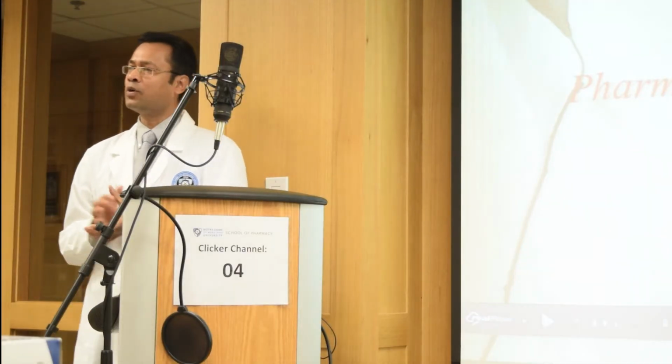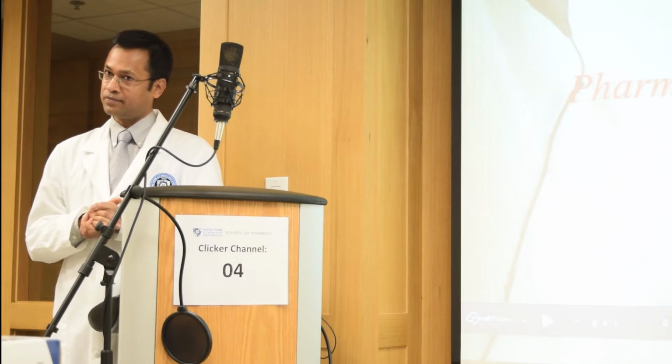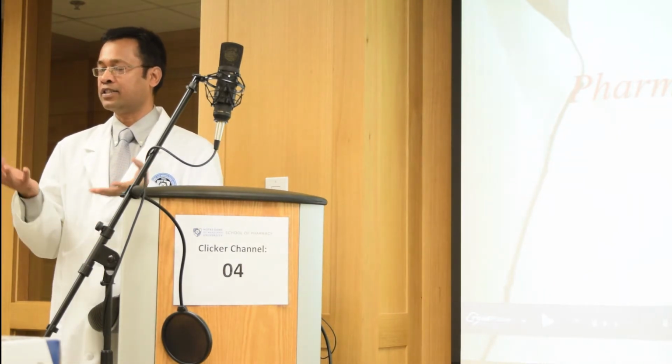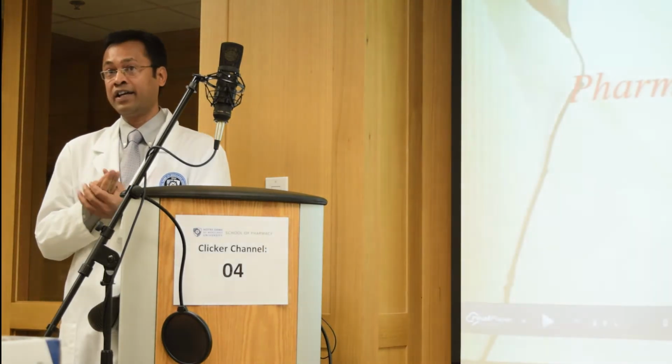So what do you guys think? What is the relevance of this lab with respect to the School of Pharmacy? What are the things that you really learned from this lab? Number one, how to use a mortar and pestle, right?